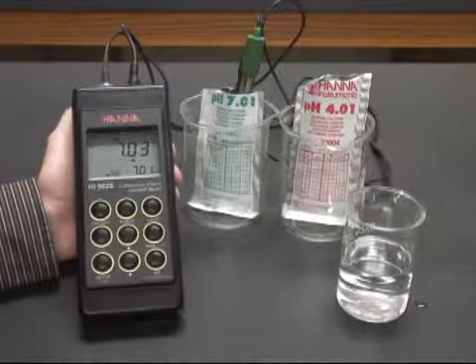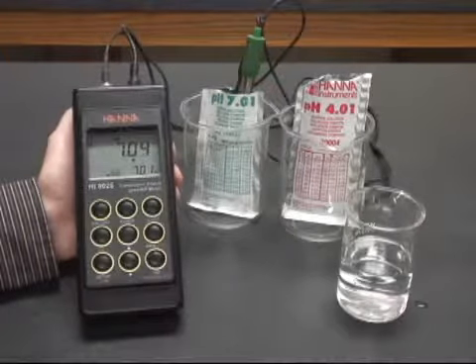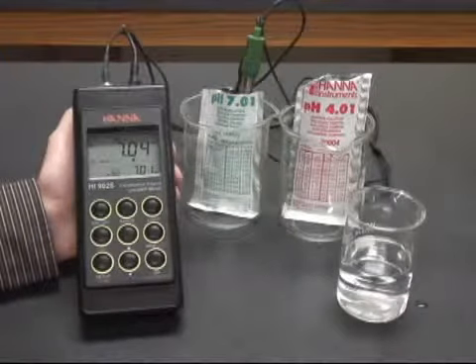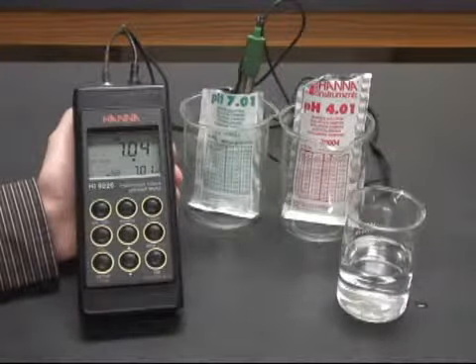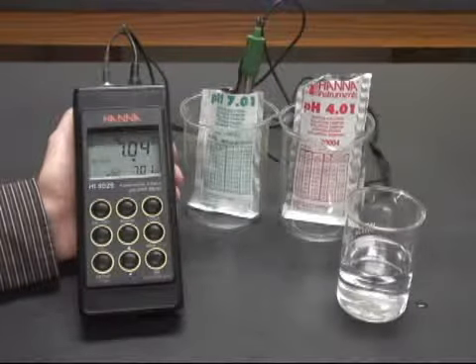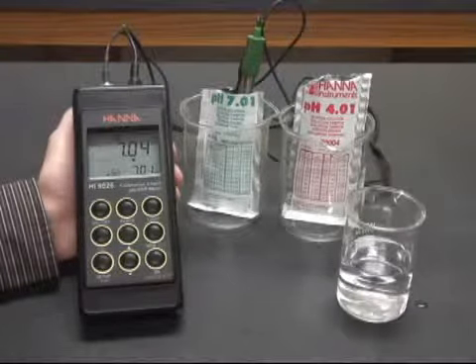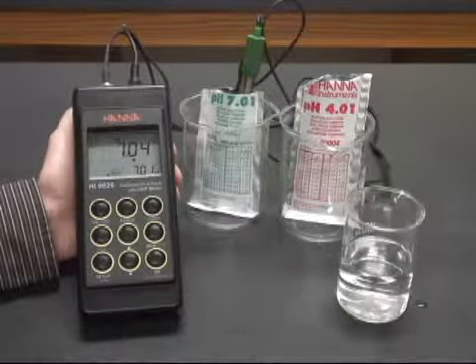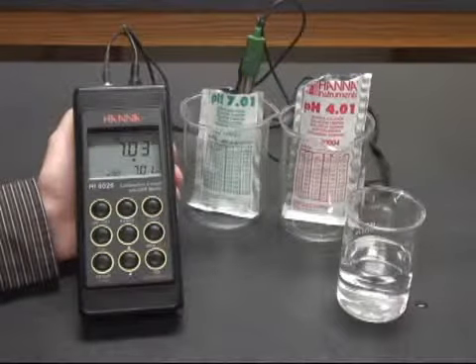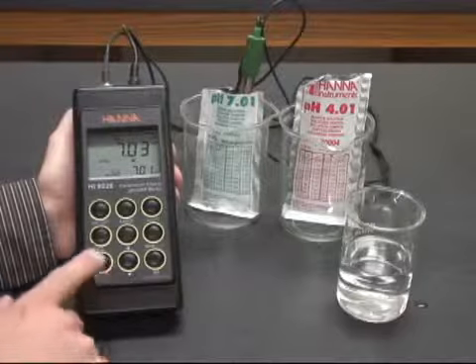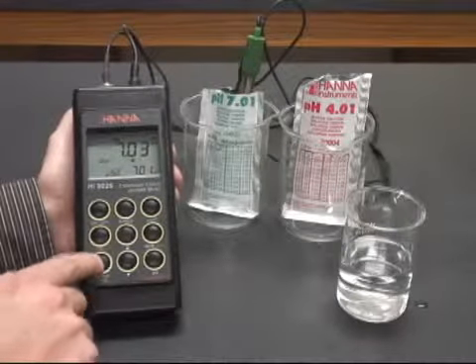Within a few seconds the meter should calibrate automatically to the 7.01 standard and ask you to confirm that standard. You hit the confirm button in the bottom left hand corner.